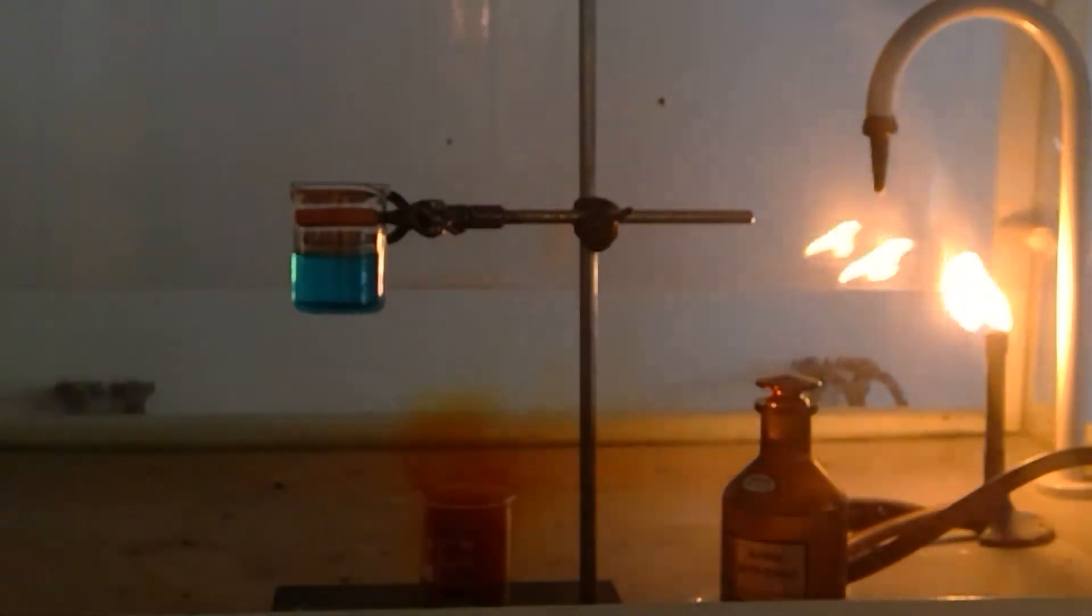Similarly at the bottom you can see that there is copious quantities of the brown gas and the copper coin is disappearing, although not so easy to see with the quantity of gas that is being produced. We just let that run for a little bit longer.